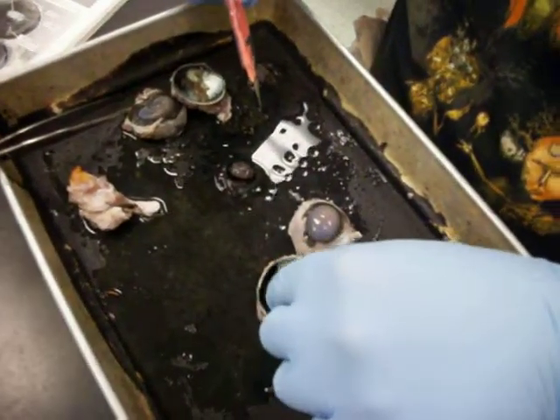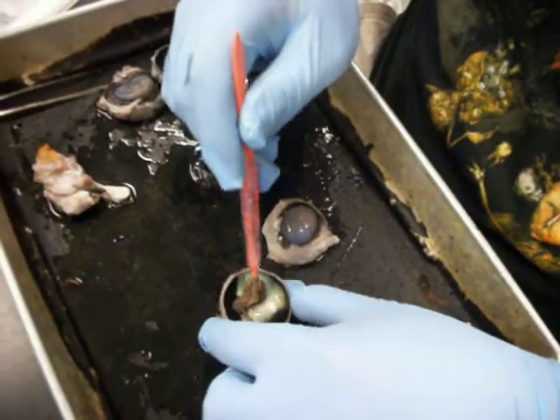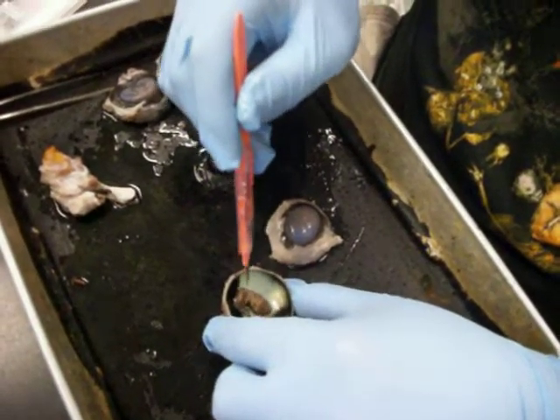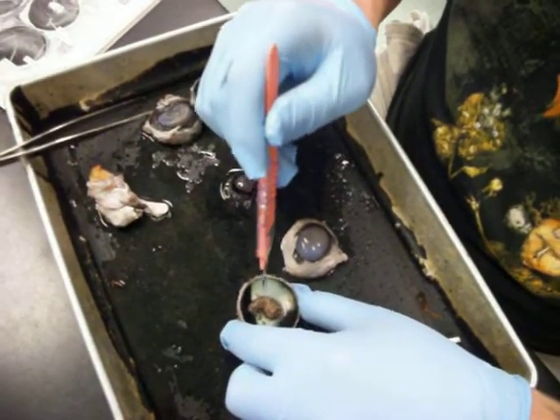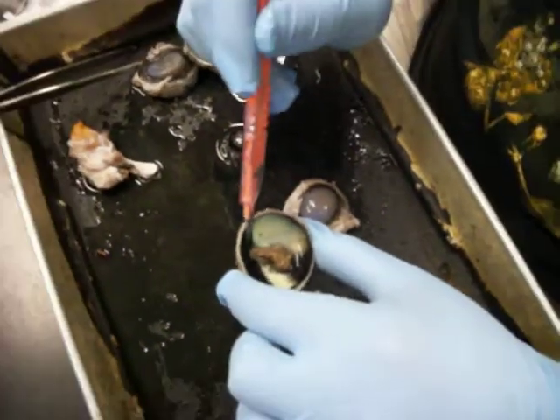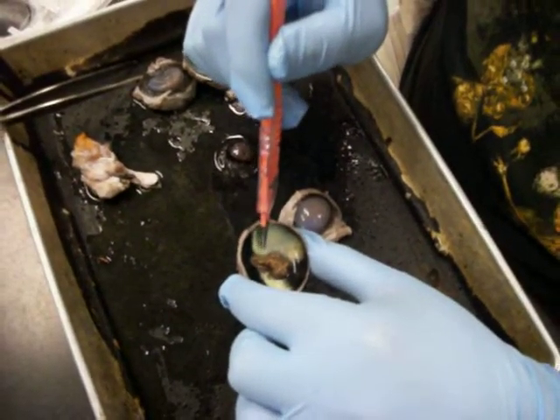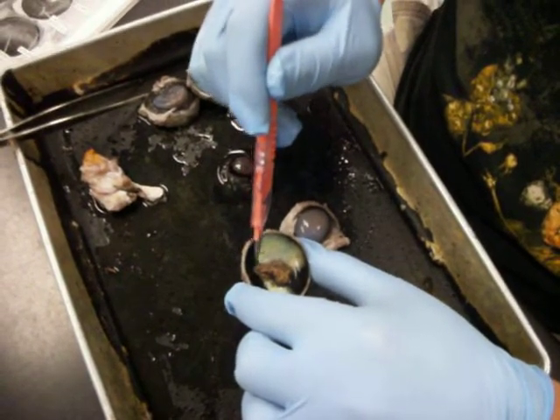Okay, wet paper towel, going back to the inside of the eyeball, posterior side. There's a wet paper towel, and it moves all around except for one side, which is still connected. That wet paper towel is the retina. And then the connection of the retina to the actual eyeball, or where it attaches, is known as the blind spot.